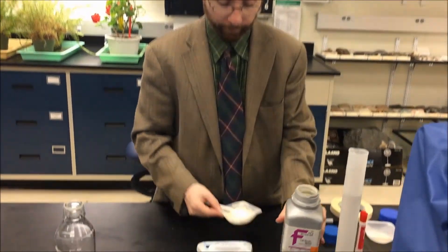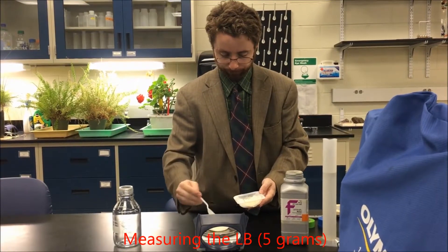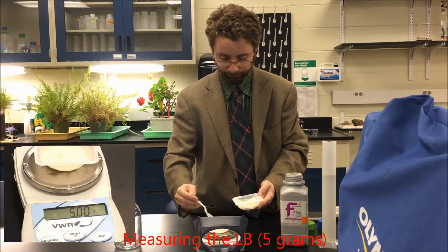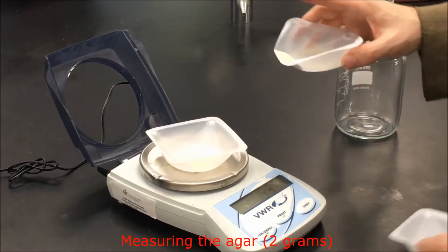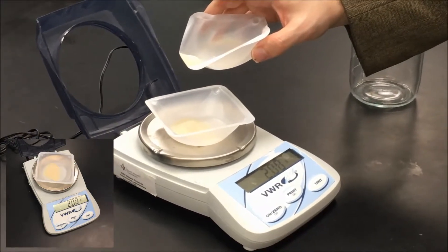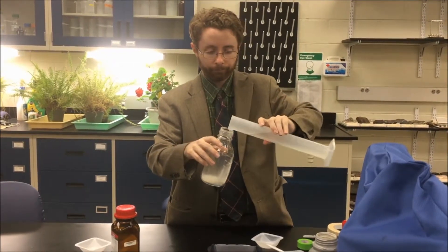So I'll begin by massing out 5 grams. We can then take our 200 mils of water and add it to the powder.